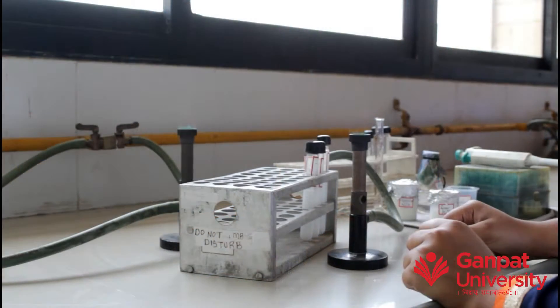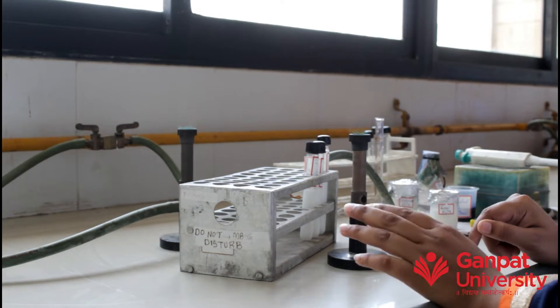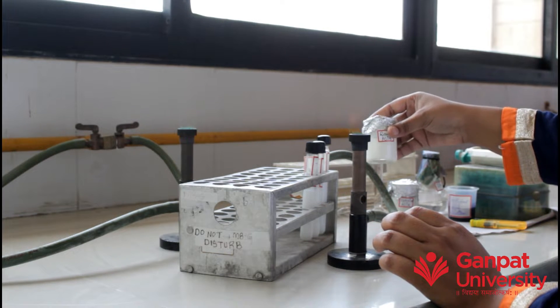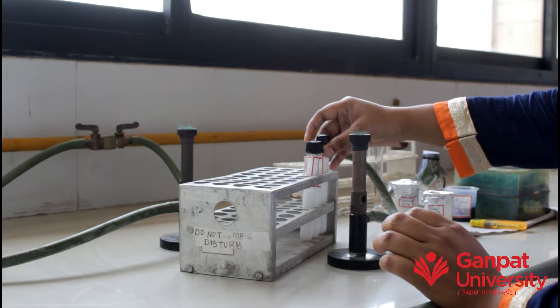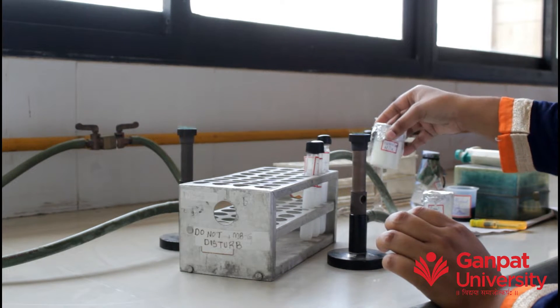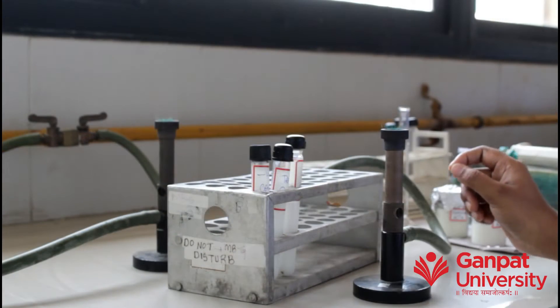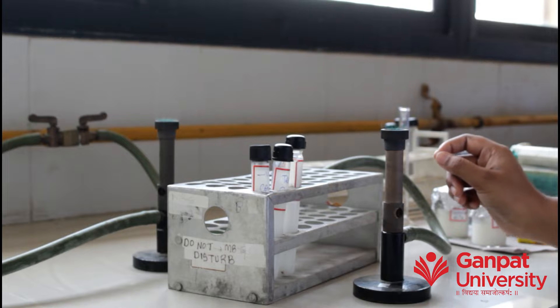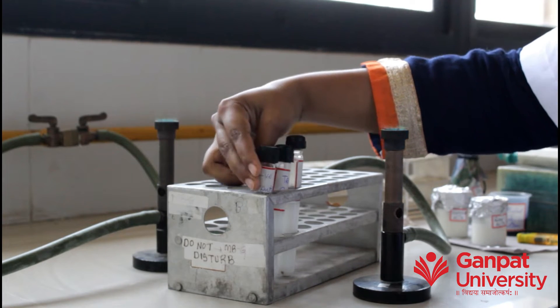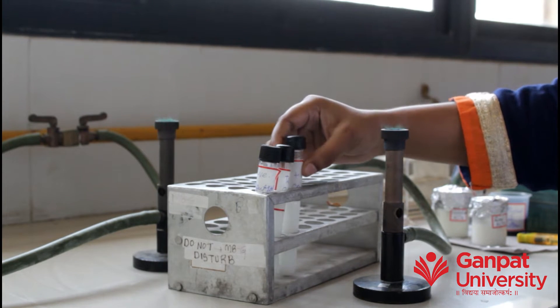Before starting the practical, clean the working area with 70% alcohol. Add 10 ml raw milk in the test sample and 10 ml milk in the positive control. Take three screw cap sterile tubes and fill them with milk sample, labelled as negative control, test sample, and positive control.